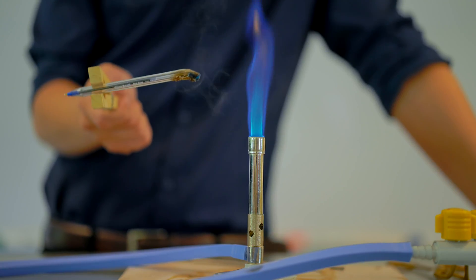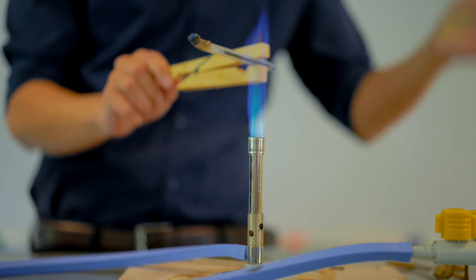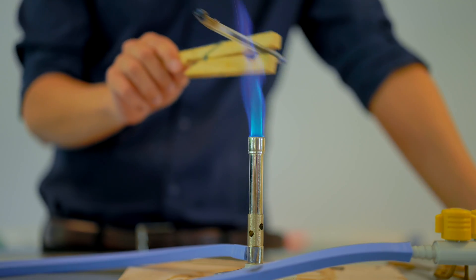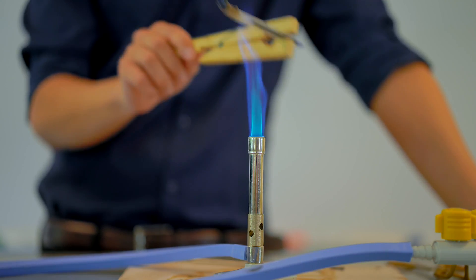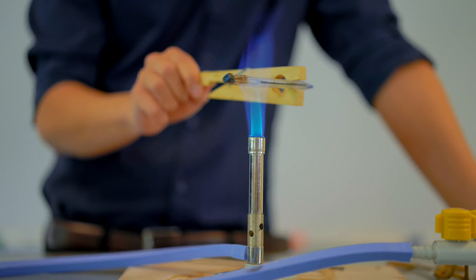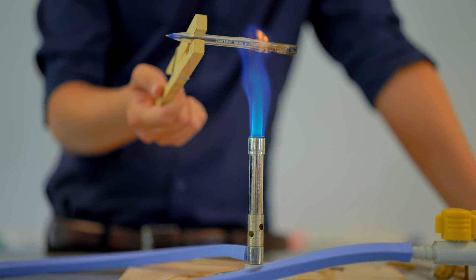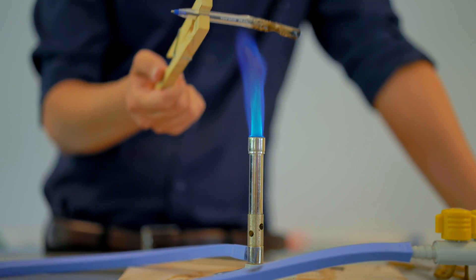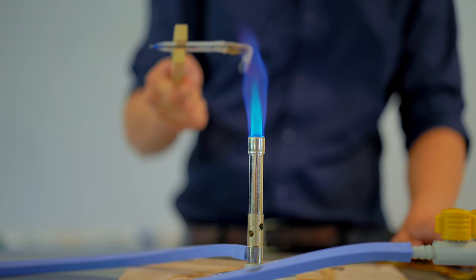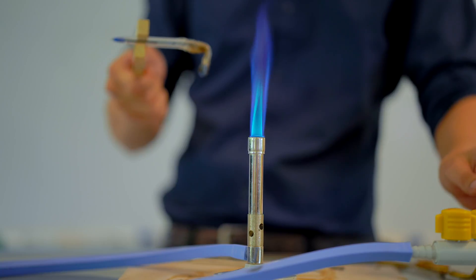You definitely saw flames coming off of it. I can smell it now — don't breathe it in. To the student who lent this to me, thank you. It's like a marshmallow on an extremely hot fire. Burn the ink — there we go. Now I'm just going to let it cool.